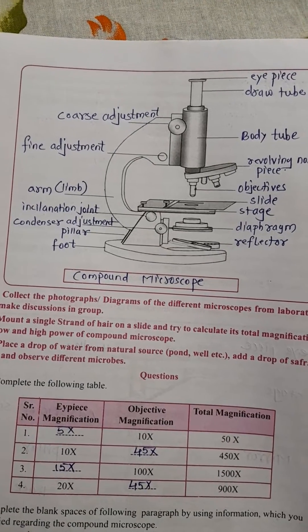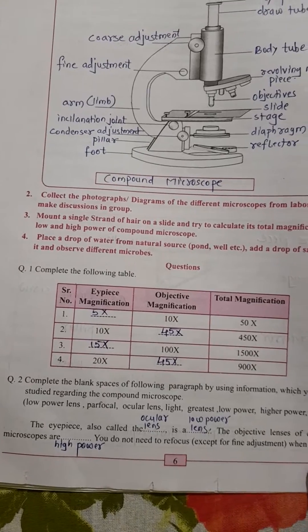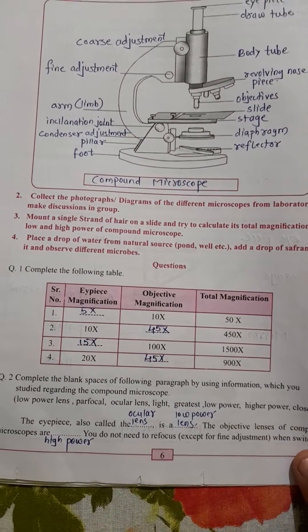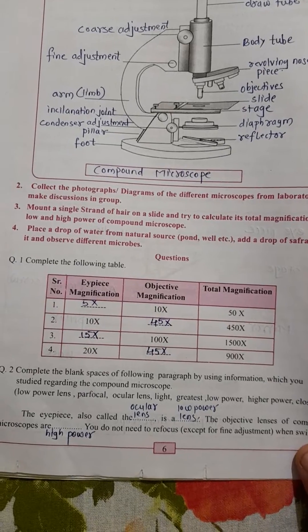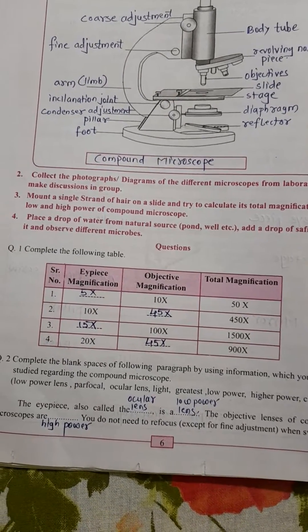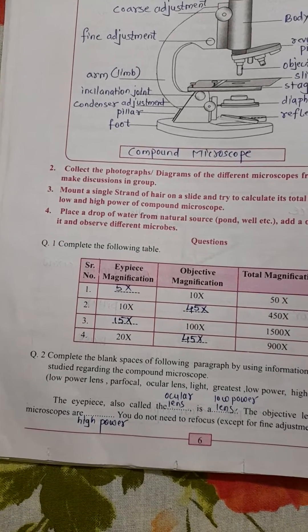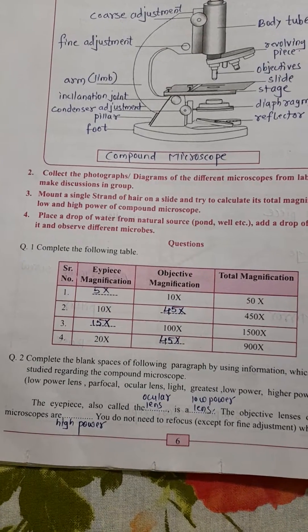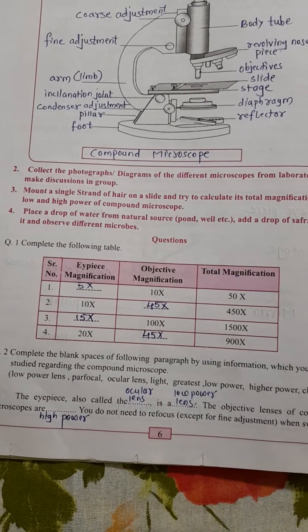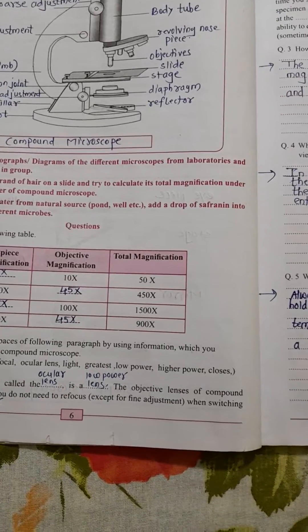Next, complete the following table — already filled in with the answers: eyepiece magnification, objective magnification, and total magnification. Question number two: complete the blank spaces of the following paragraph using the given information. The proper and correct answers are provided for all students.